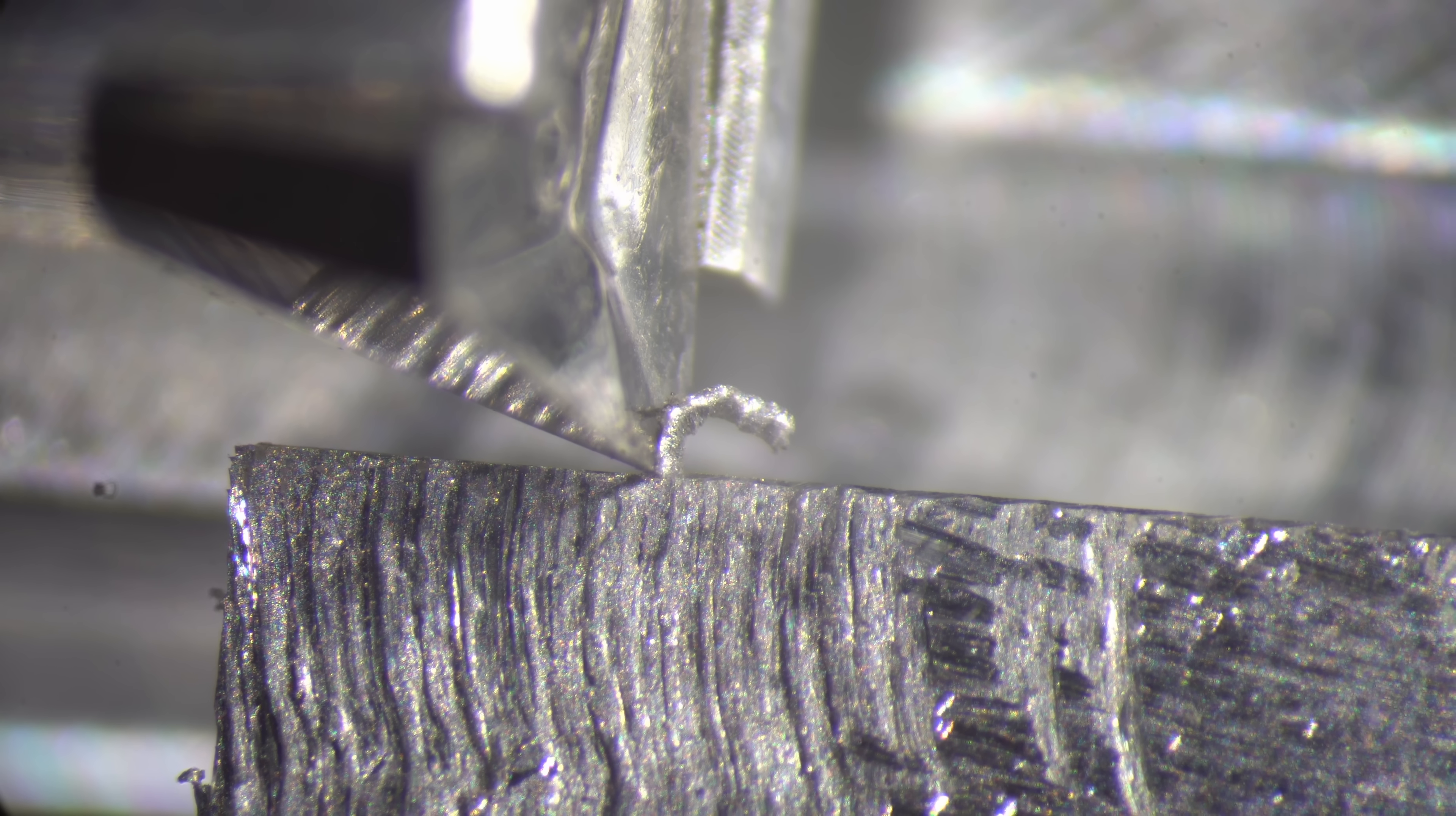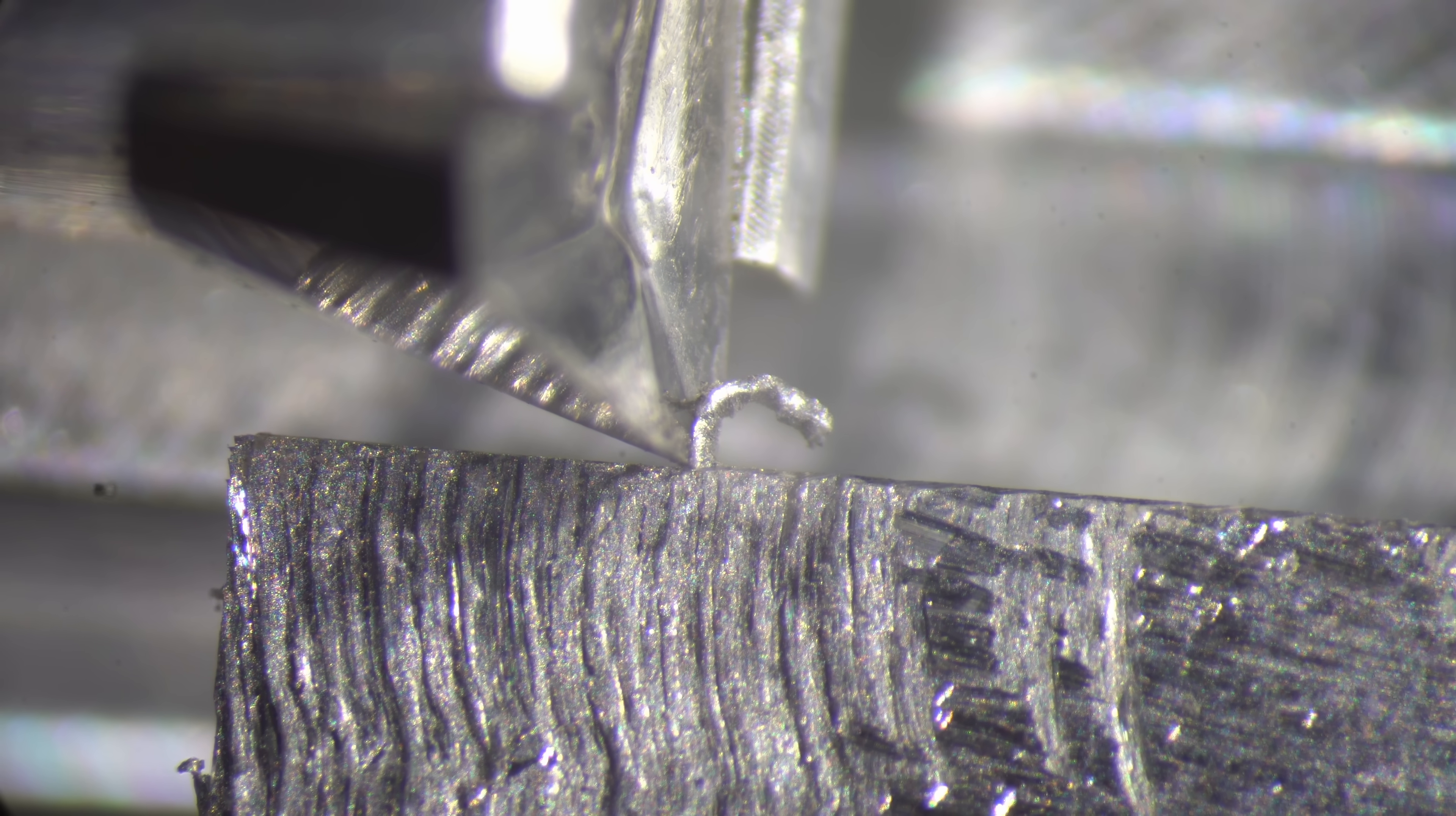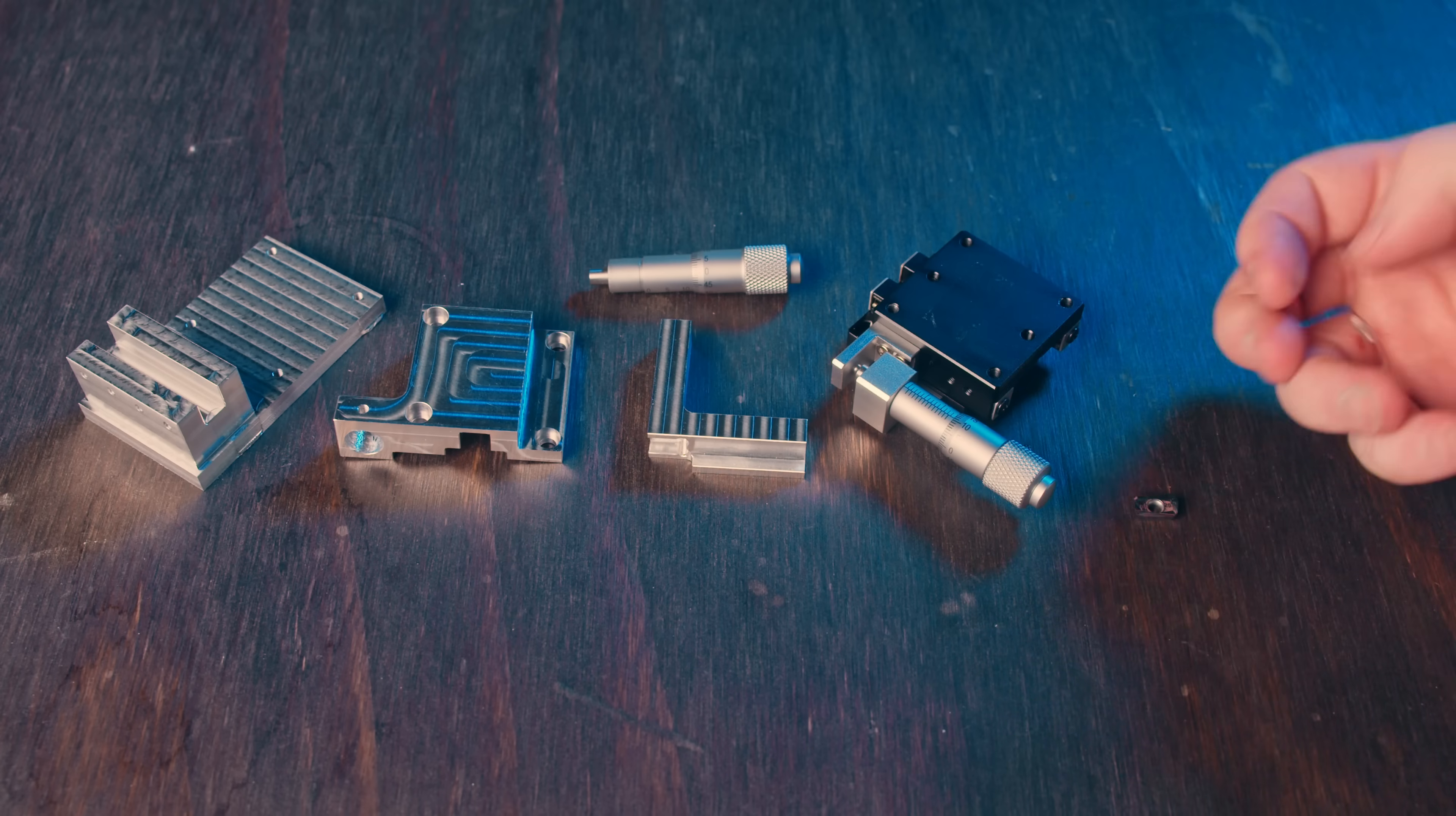I've always wanted to see this in action under a microscope so that we could watch the carbide cut real metal and watch all these features interact with the metal in real time. And I wanted to see it under a scanning electron microscope because I don't know, how cool would that be? So to do this, we need to make a little fixture to cut the metal inside of my microscope. This is what I came up with.